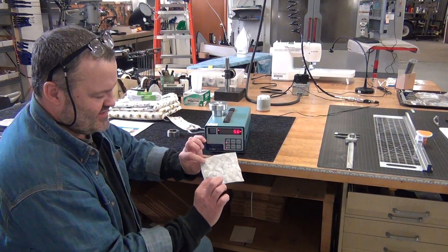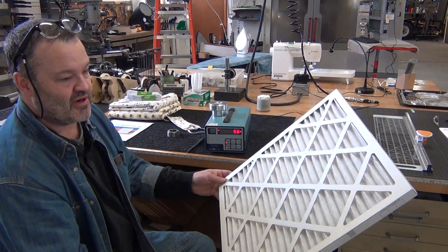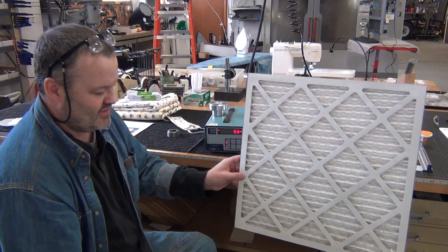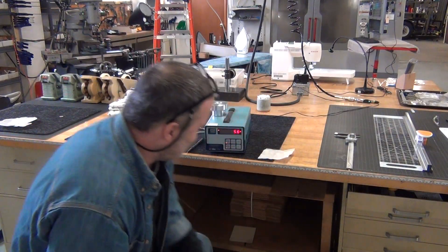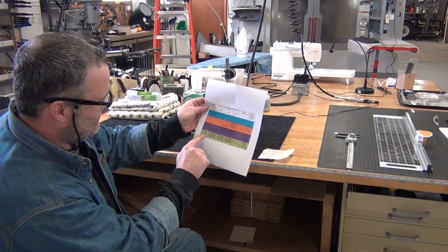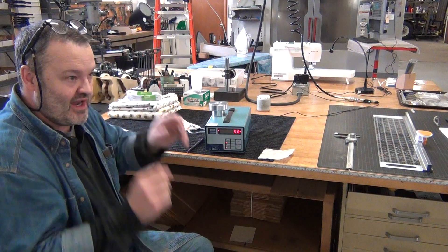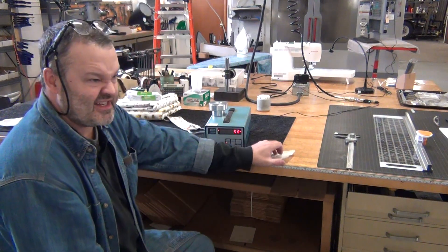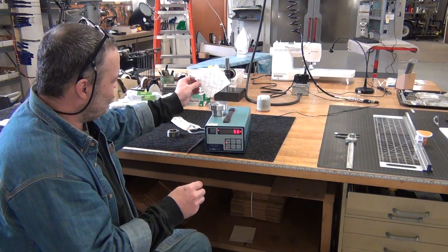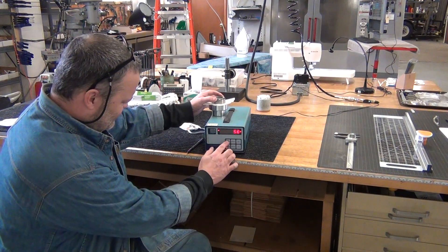Let's go to the next material. This is a filter material — basically I took one of these MERV-13 furnace filters and cut it up to see what it would do. It is rated at one micron. MERV-13 is supposed to do 85% or better. This gives me a way to see if my test technique is correct. Let me put that on there — I think that side goes down — and I'll put my cover on and see what we get.